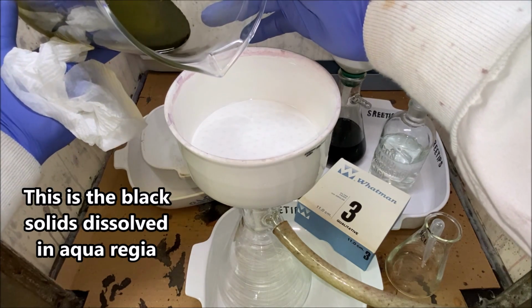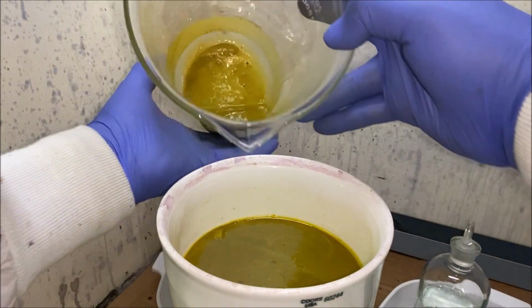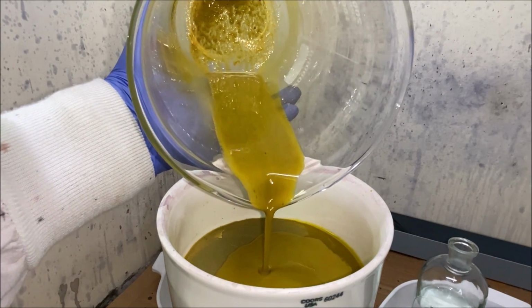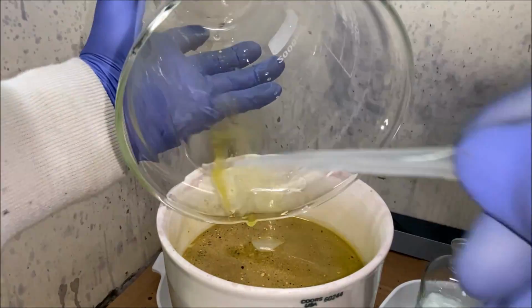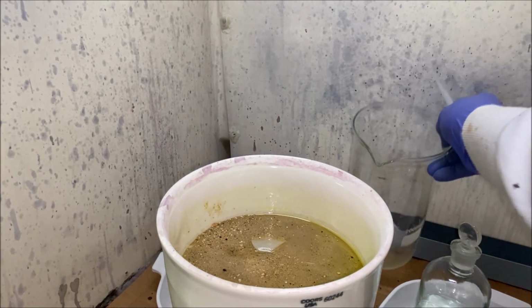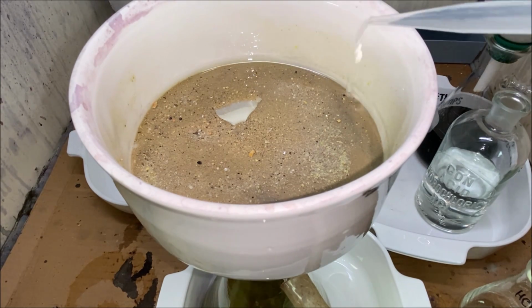There we go. Let's get the rest of this material in this filter. I'm going to use hydrochloric acid to rinse it out of the beaker. Here's what's left in the filter. So now we're going to rinse the funnel real good with some hydrochloric acid.